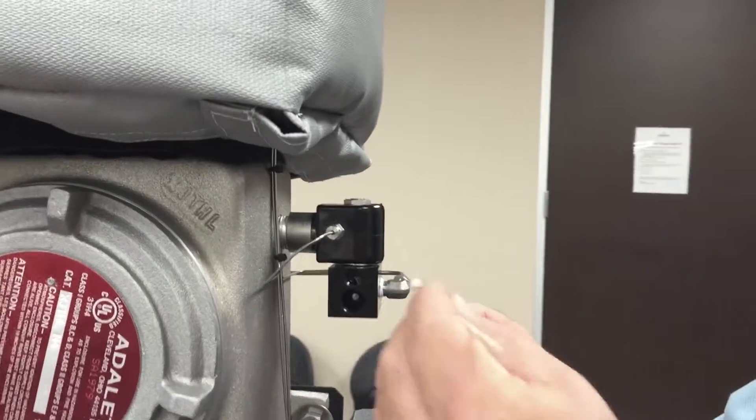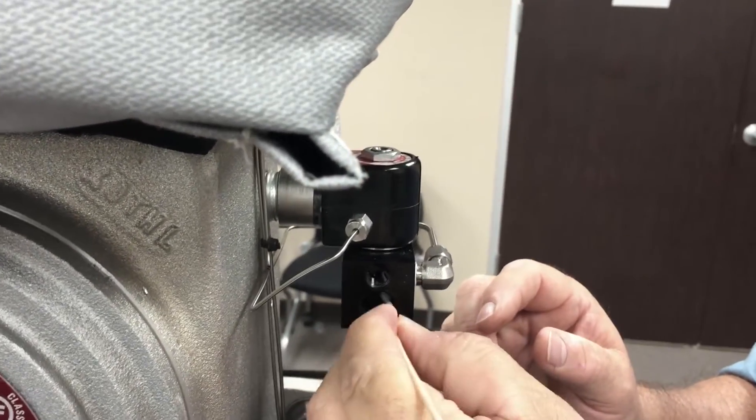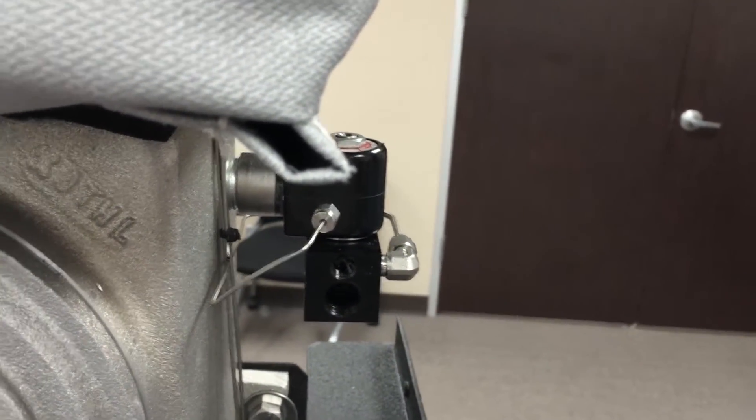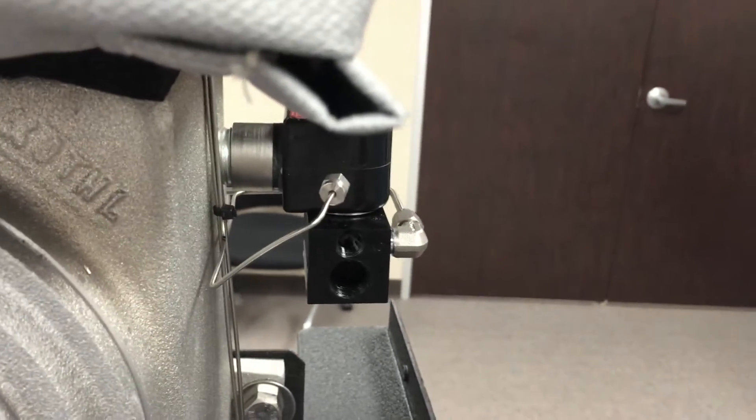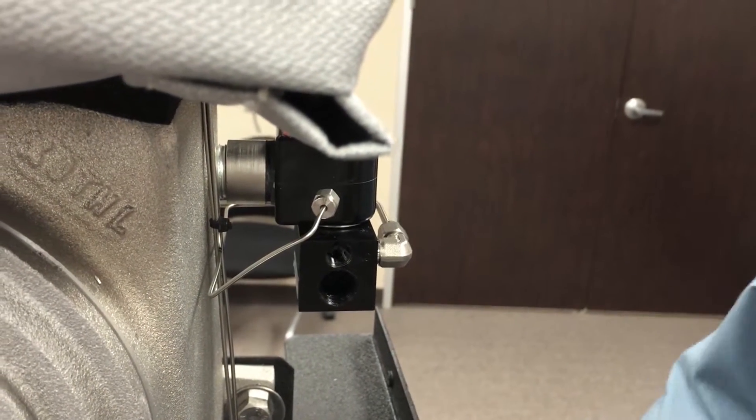After you remove those two items, then you use a Q-tip to swab the inside of the travel portion of the Fabco. This will remove any old debris that might be in there that could scar the travel portion.